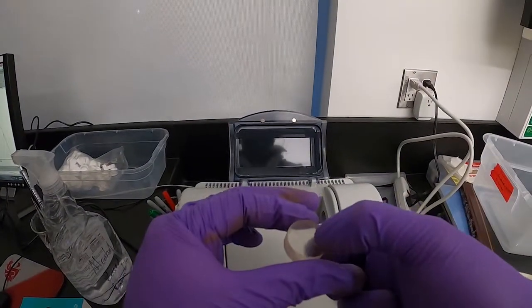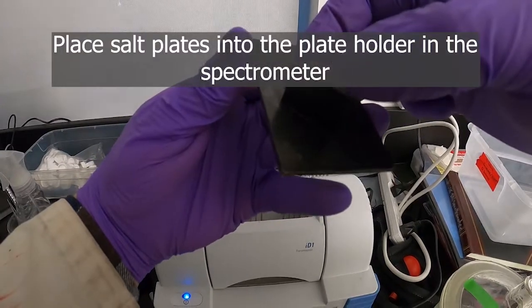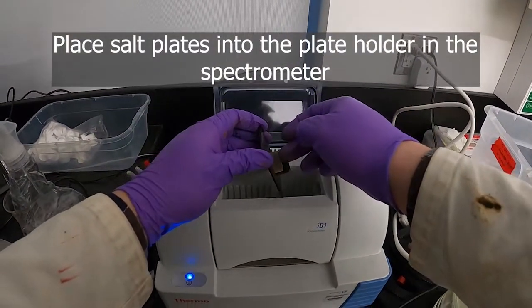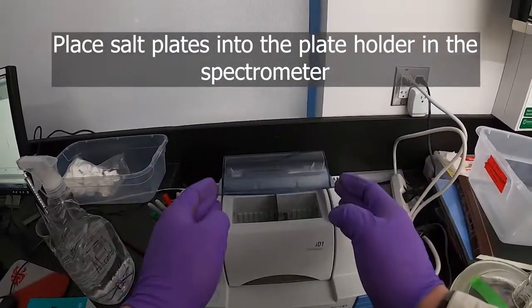Put it back over the spectrometer, just carefully put the plates into the holder and into the spectrometer.